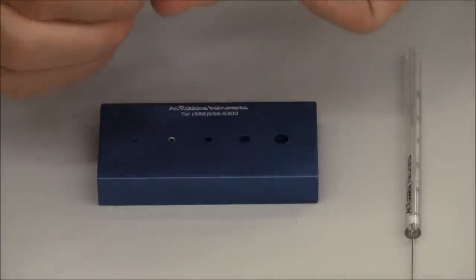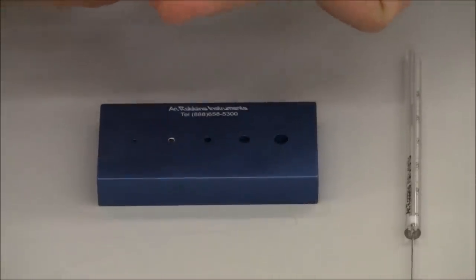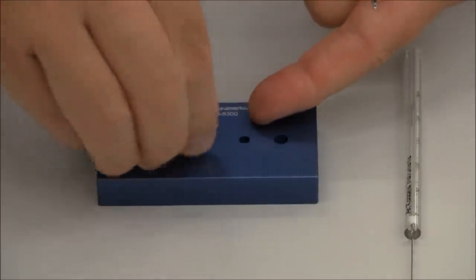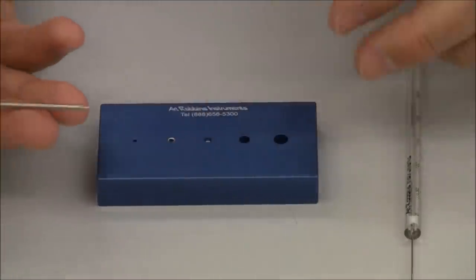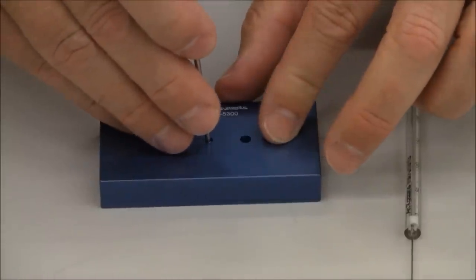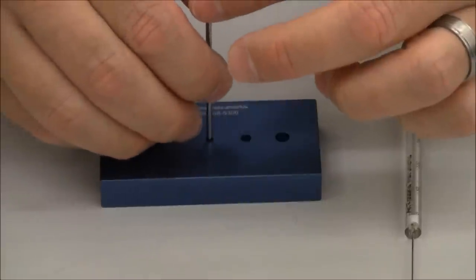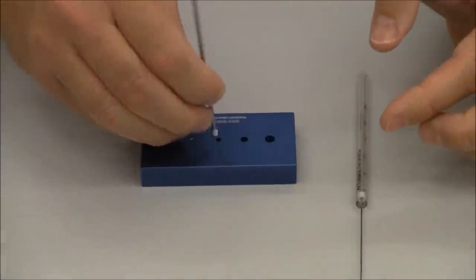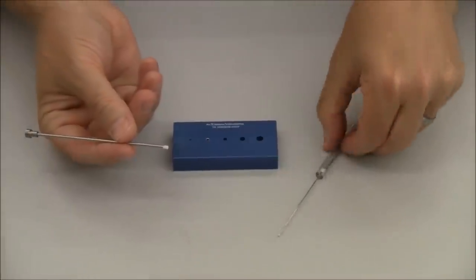Second, you take your tip, you put it in the Teflon tip tool, take the plunger, softly and carefully insert it in the middle, push down firmly, pull it out, Teflon tip is on.